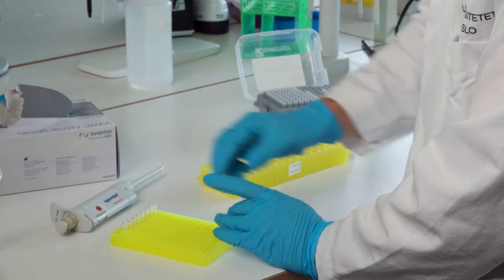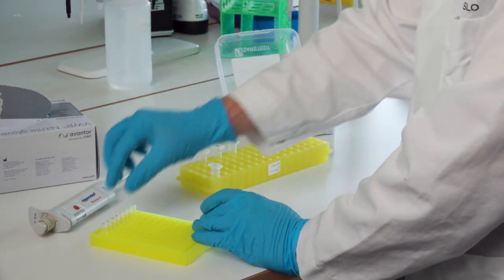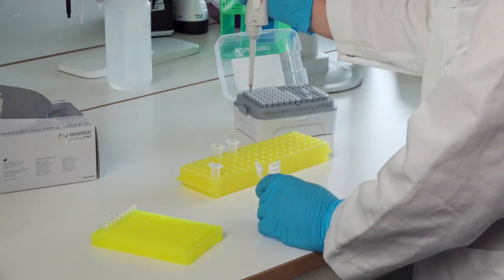Discard the tip, and then I move it down so I know this is done. And then I do the same for number two as well.